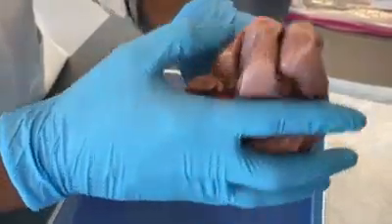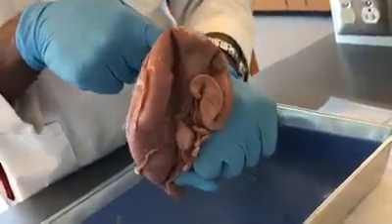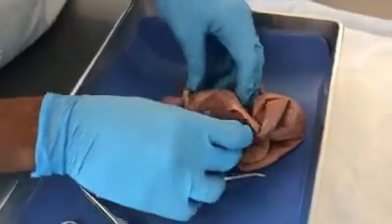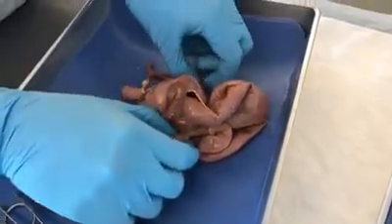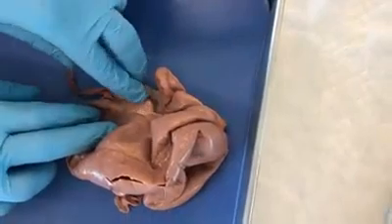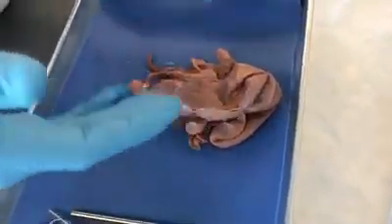and the uterus is going to sit on top of or posterior to the bladder, and so my glove would denote the urinary bladder. So when we look at the uterus and we see it from the posterior angle, we see there are two ovaries here. The ovary to my right is the right ovary, and the ovary to my left is the left ovary. And this is because we are looking at the uterus from the posterior view.